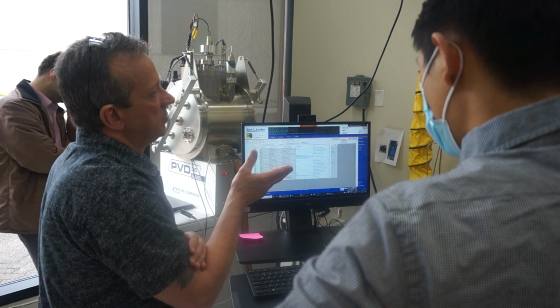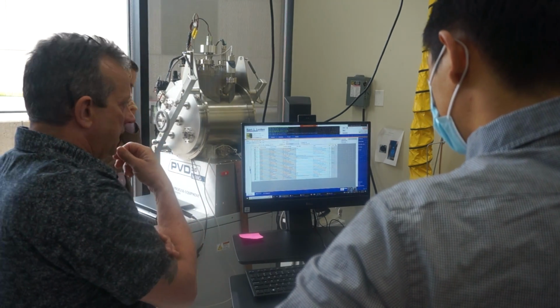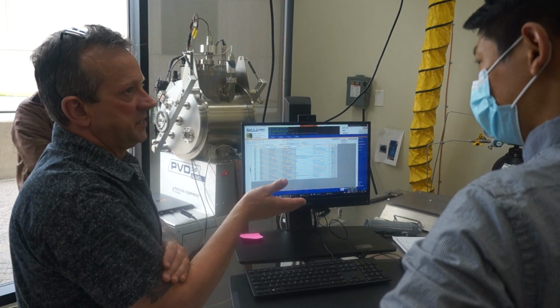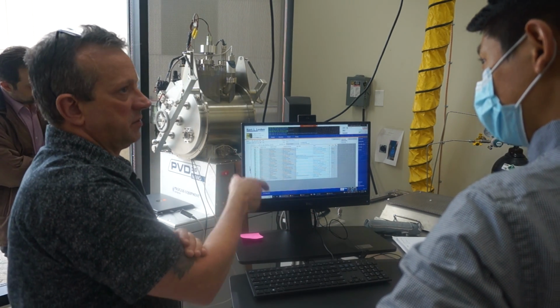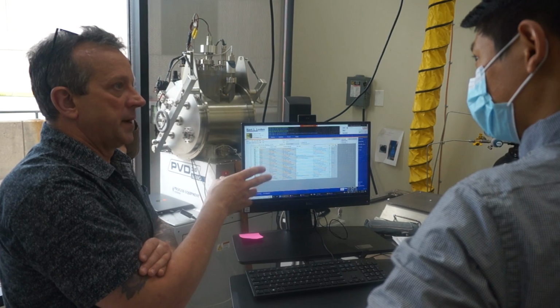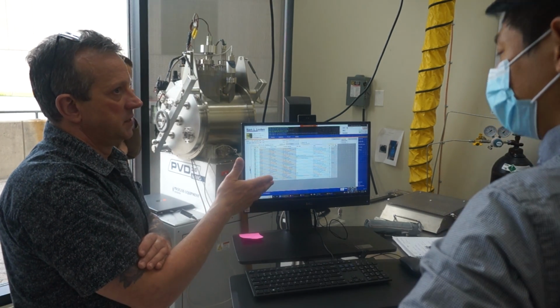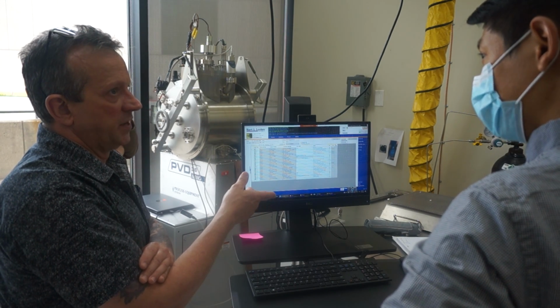That's another scenario where you would say, I saw this paper from Duke where they're running this material on an Oxford ALD system. Could that material be run on the Lesker ALD system? It's going to be yes, but the parameters might be a little bit different because it's a different piece of equipment. This is better than an Oxford system, but it's also a little bit more money too.